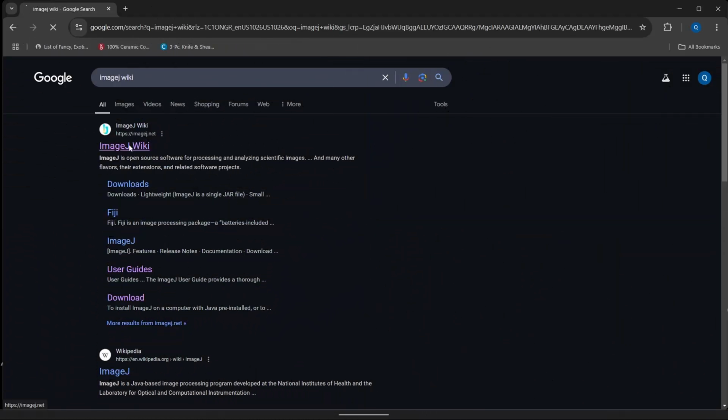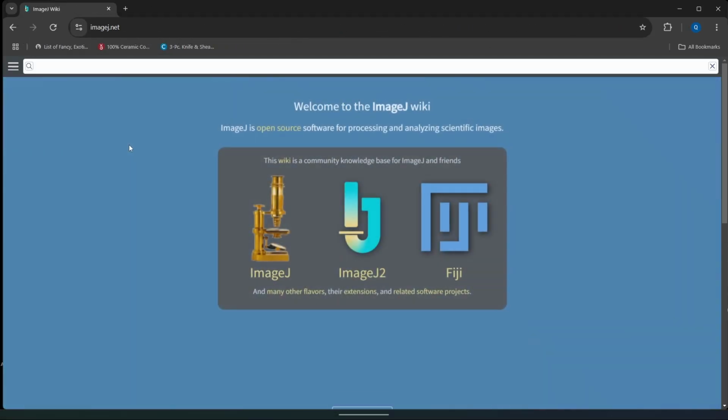All right, so as a little addendum, I kind of wanted to take you guys through the ImageJ wiki. ImageJ or FIJI is an open source software, which just means that anybody can edit how it functions and create little plugins for it that allow it to do new things. So we're not waiting on a development team to do all of this, we can kind of do it ourselves. Which means that ImageJ has a lot of functionality that some of even the best softwares out there don't really have.